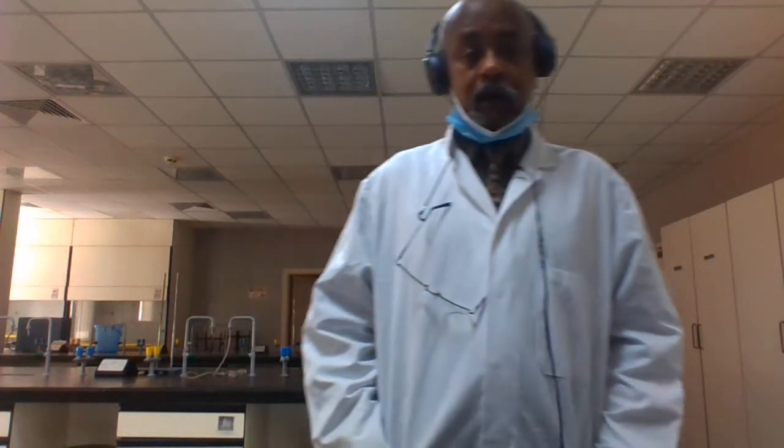Here we are not going to test for nucleic acid in our lab, and it will not be included in our experiment. That means we have to test for organic compounds containing protein, carbohydrate and lipids. For carbohydrate, in the lab we have two types: saccharide and starch. And the test for saccharide is different from the test for starch.